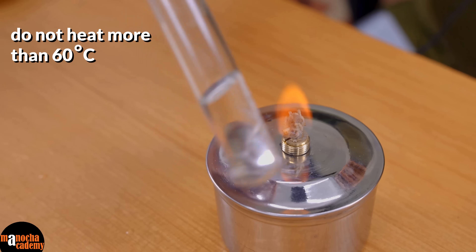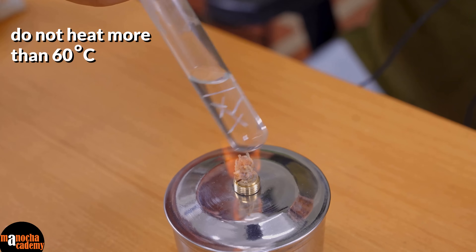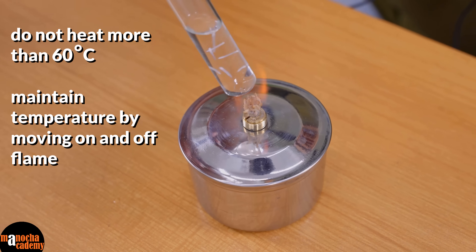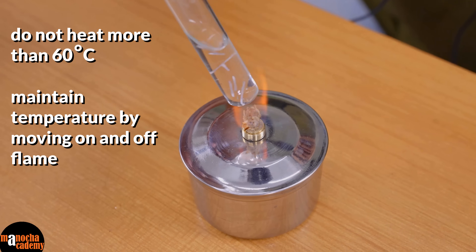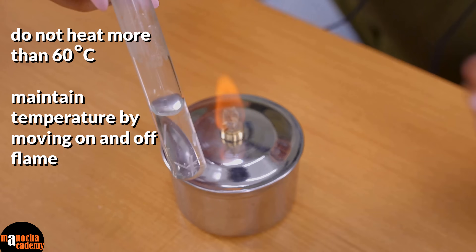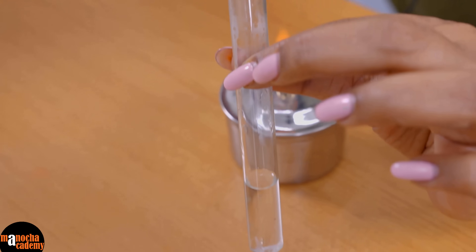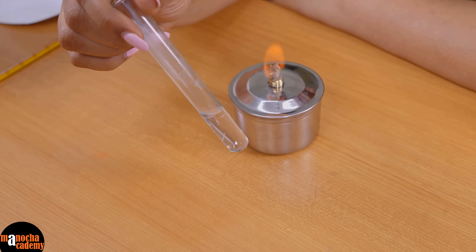So I have taken it off and now I am waiting for the temperature to come down. I will cool it a little bit, then hold it again, and take it off like this. Do not directly keep holding it on the flame — hold it on the flame, take it off like this. About 2 to 3 minutes is enough most of the time, though you are usually asked to do this for 5 to 10 minutes. My experience says if you do it that long, the tissue absolutely dissolves and you can't even see the tips anymore. If you are not sure about the temperature, you can take the thermometer back and put it in.